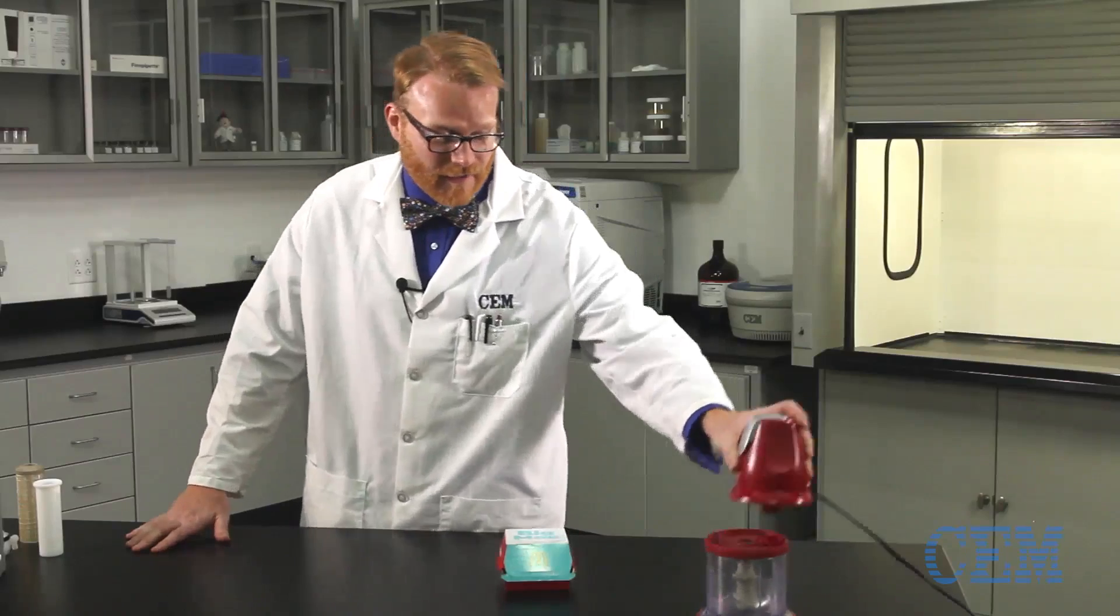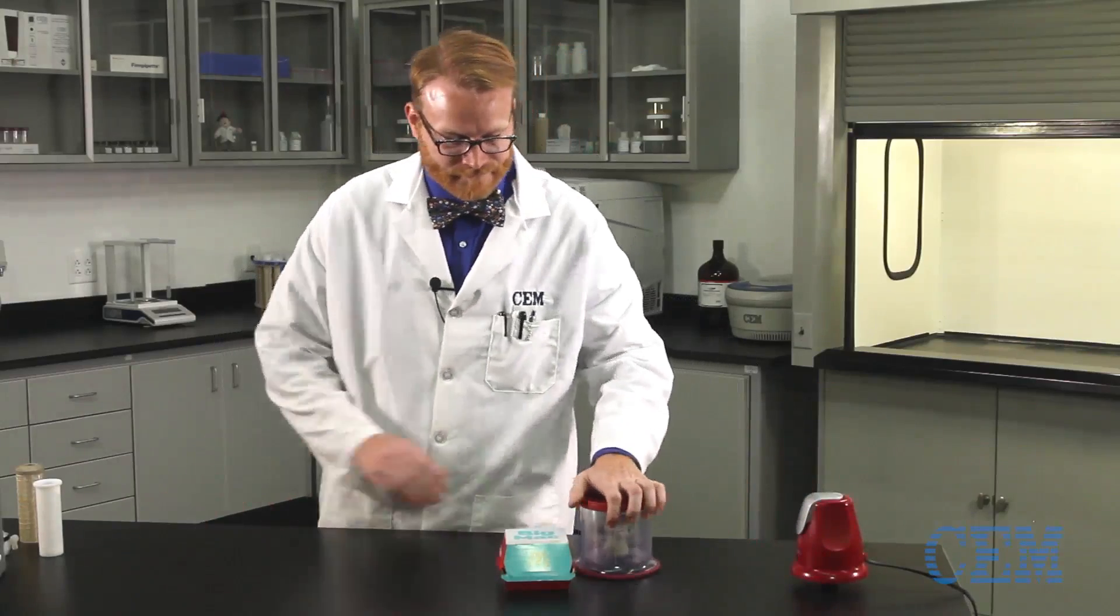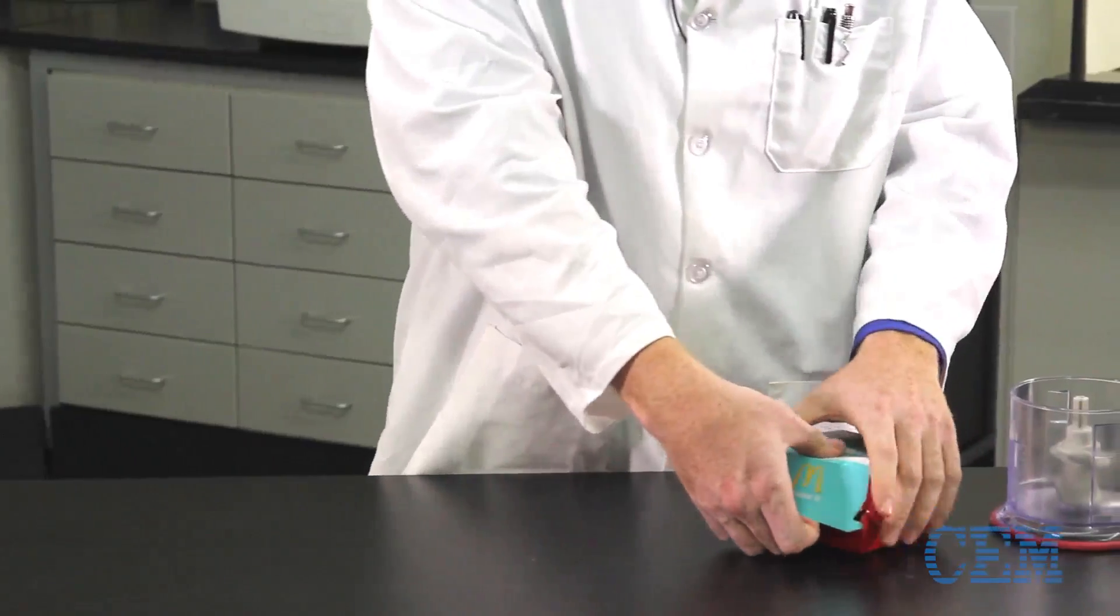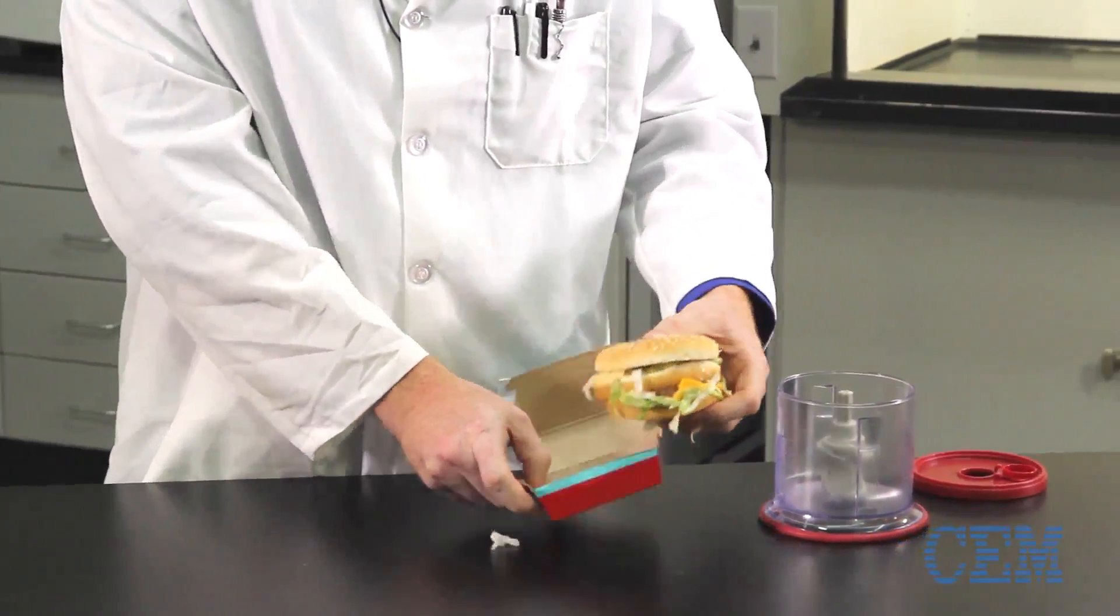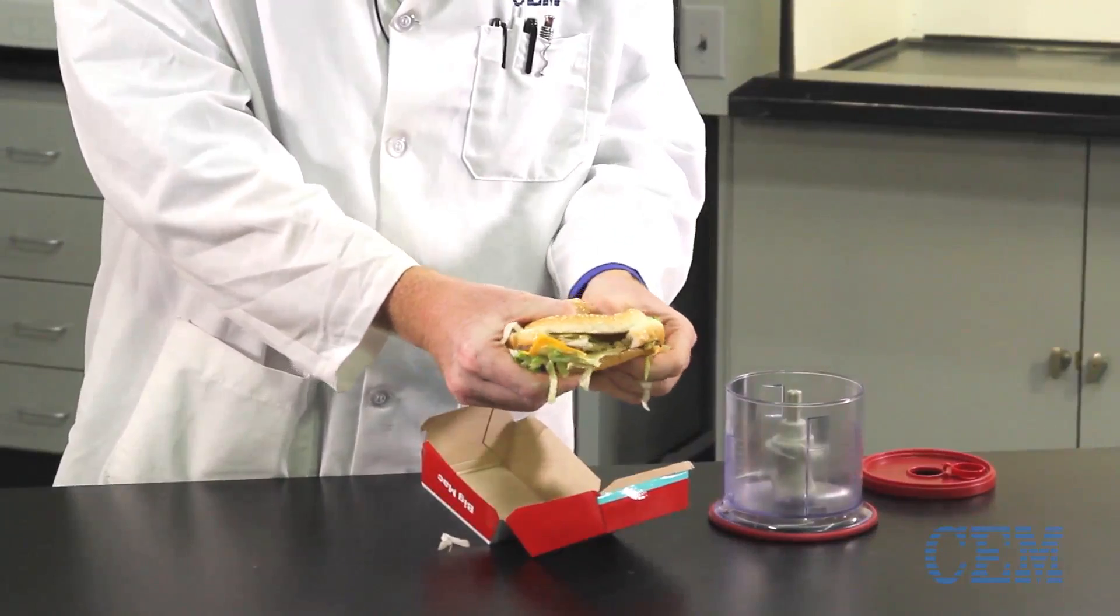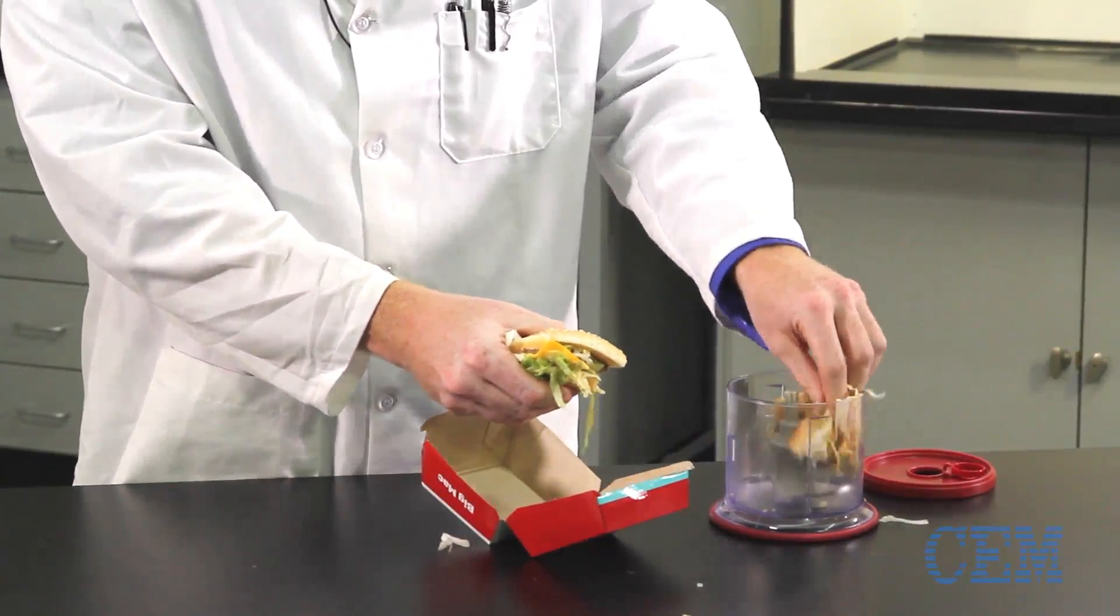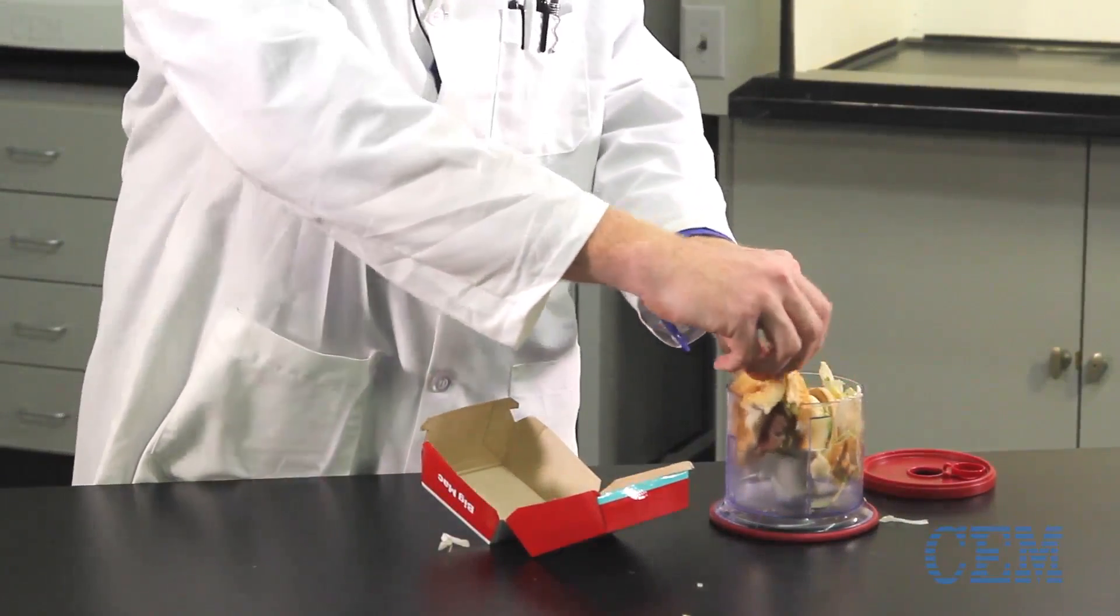In order to get a representative sample, we first have to grind it up. So we're going to put it in our grinder here. Jam it down in there nicely.